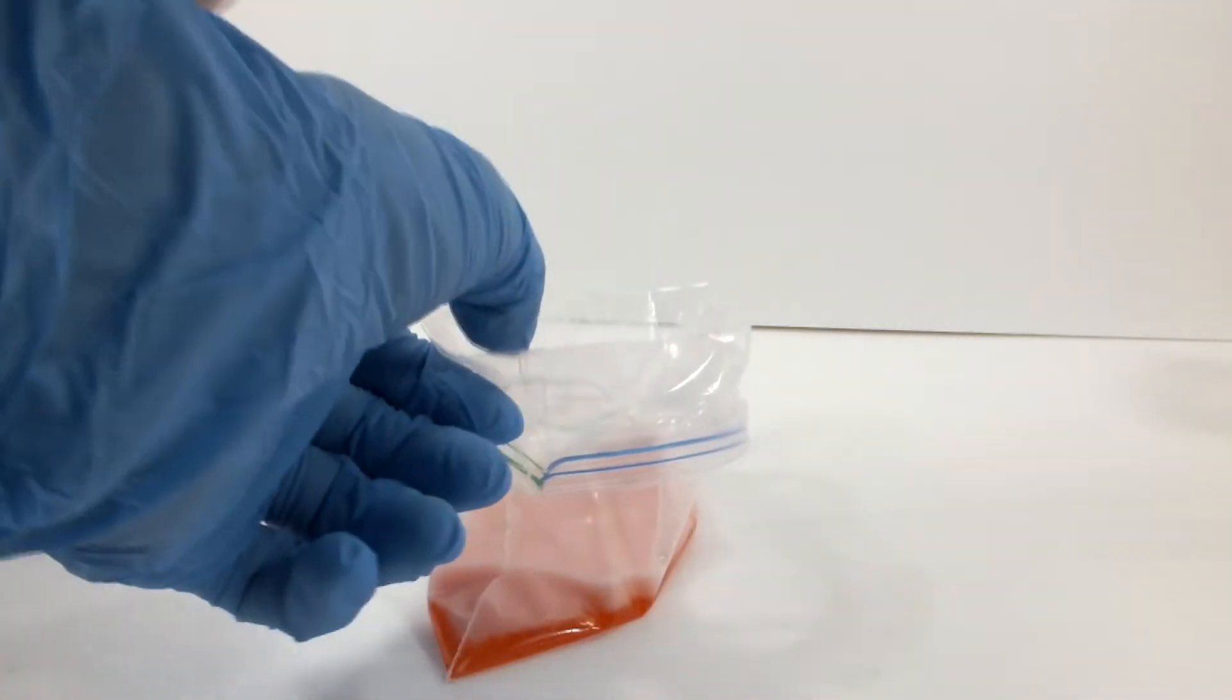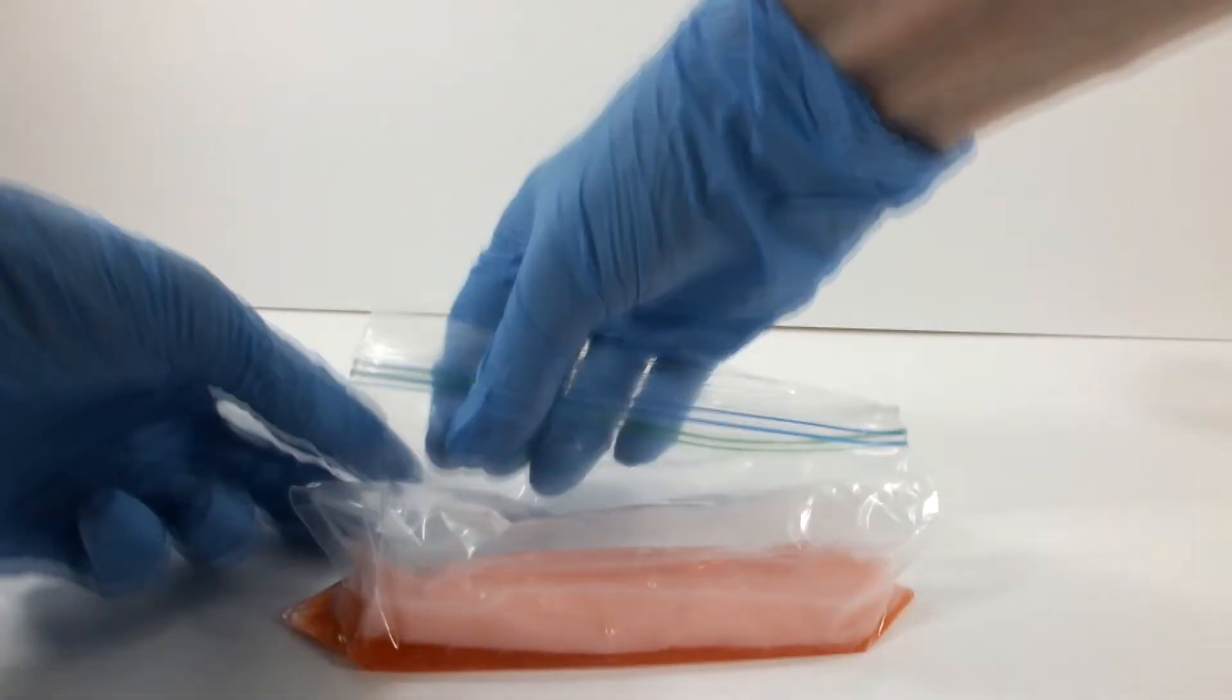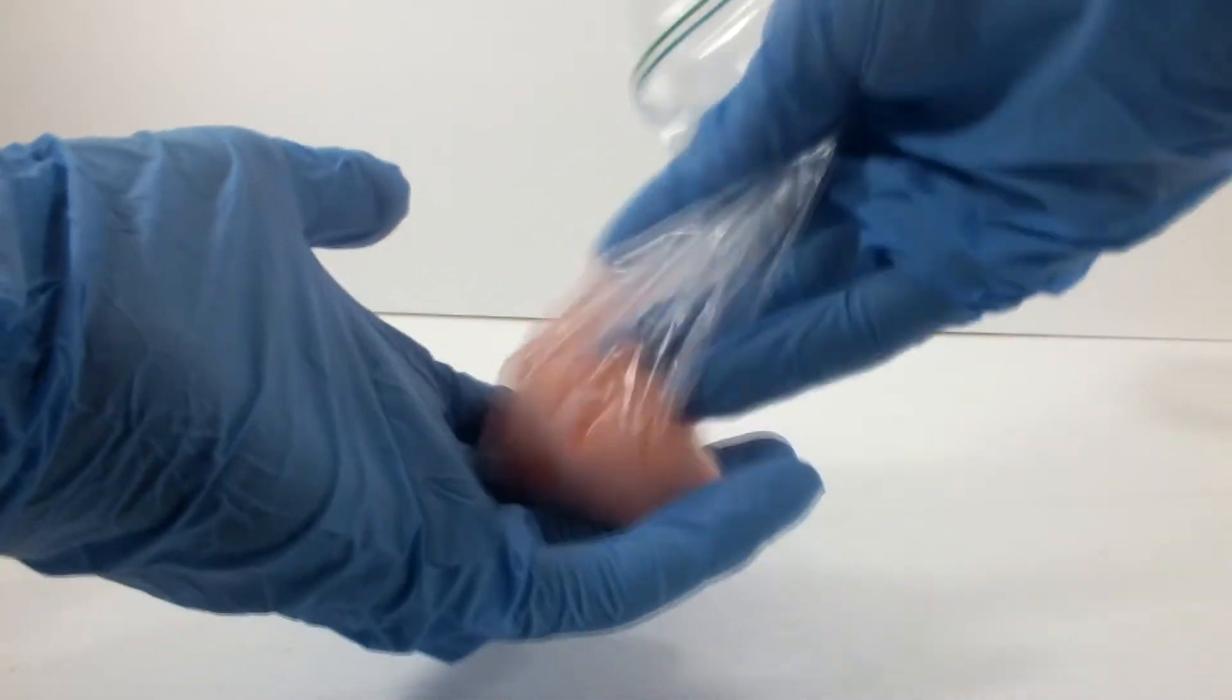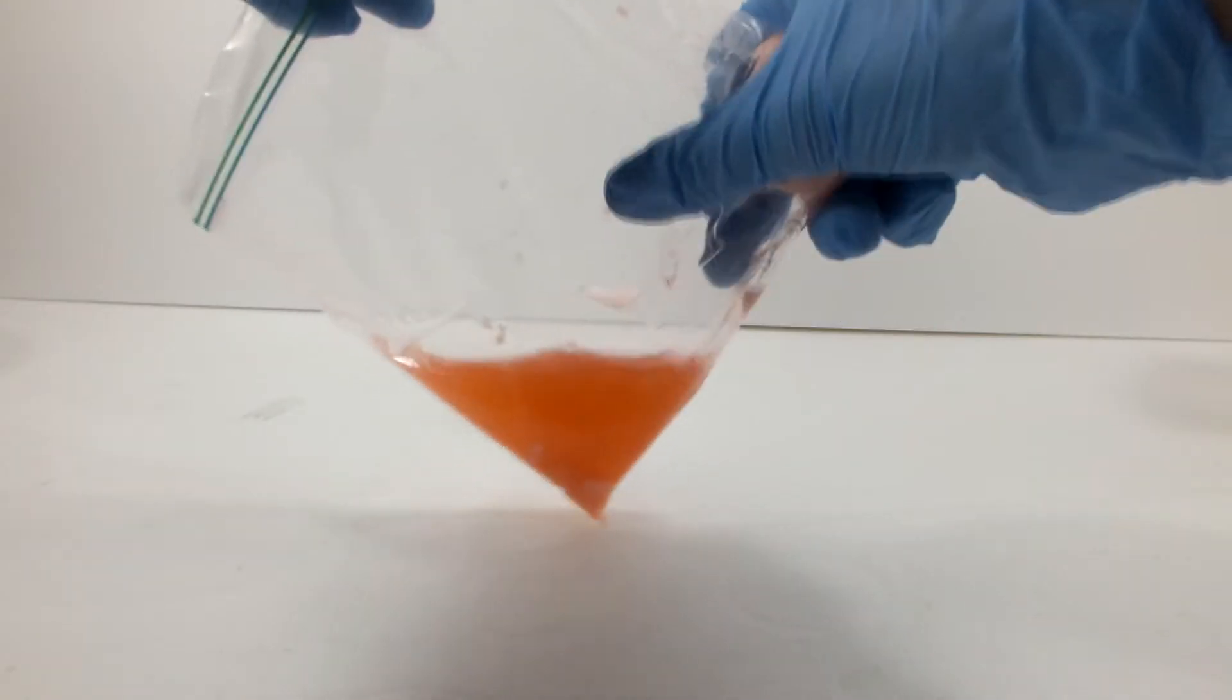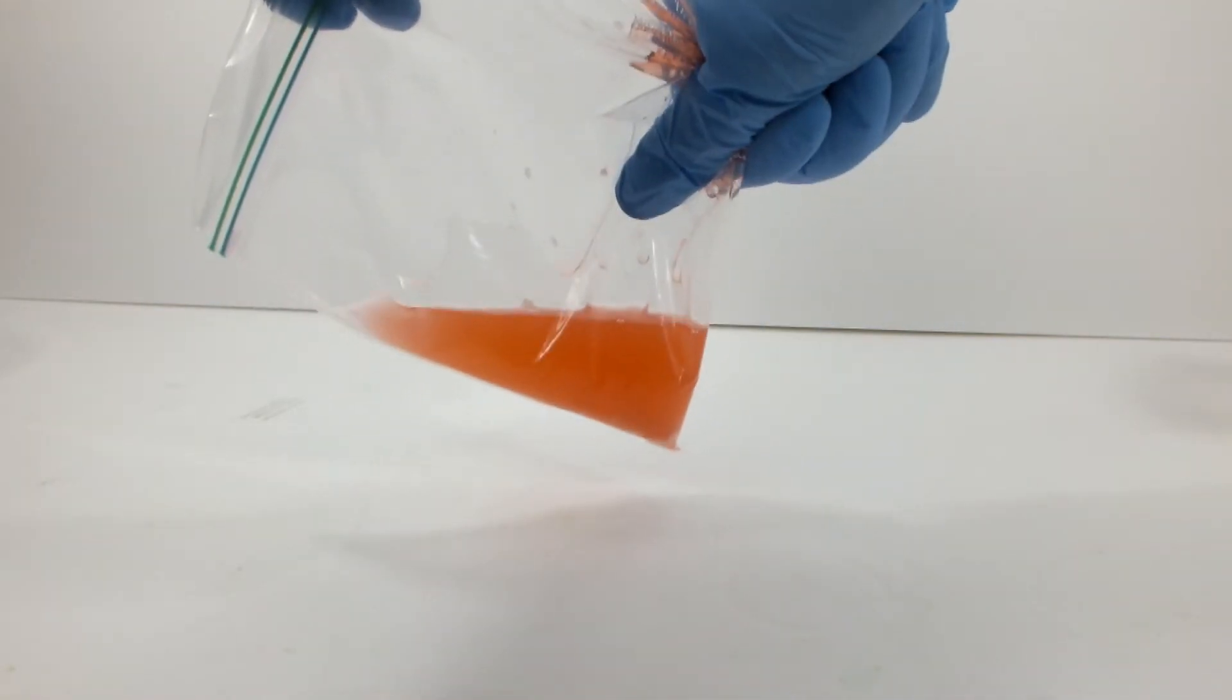It comes together very nicely, especially in comparison to the first trial, which was complete garbage. I'd like to keep working this sample, so I squeeze out as much of the water as possible into the bag, and then remove the ball. There's some extra polymer in the bag, so I fished that out too.